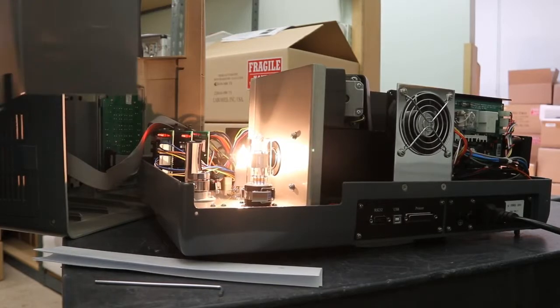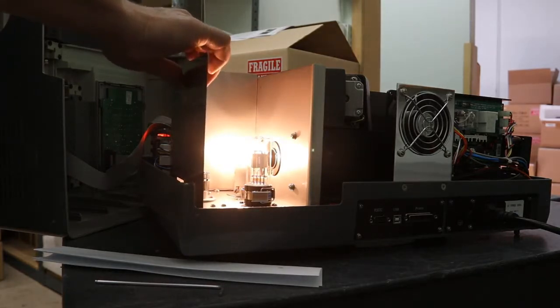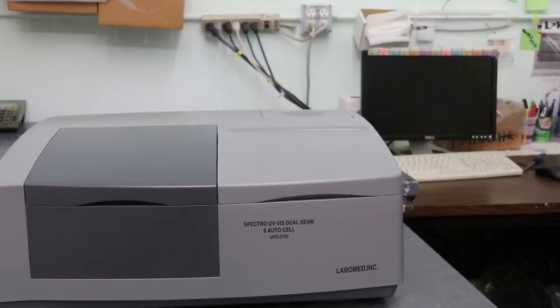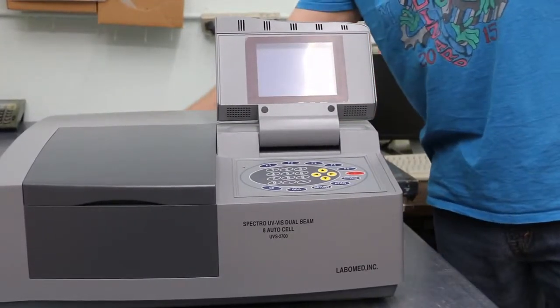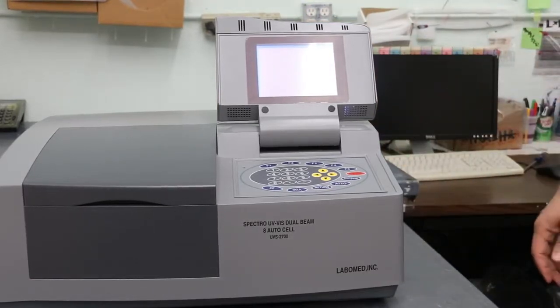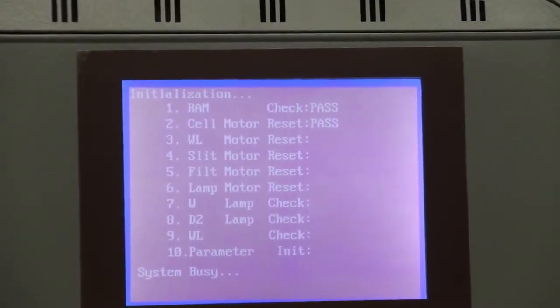With the mirror adjusted, replace the cover and all the screws. With everything reassembled, reinitialize the machine. This will verify that everything is working correctly.